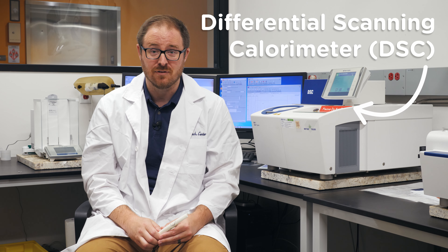When a client comes to WJE regarding a pipe failure, WJE will investigate in our laboratories to determine the cause of that failure. This is important for the client because it allows them to make decisions related to what they need to do with their pipe system.